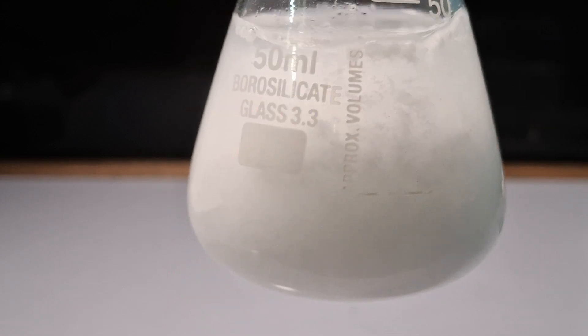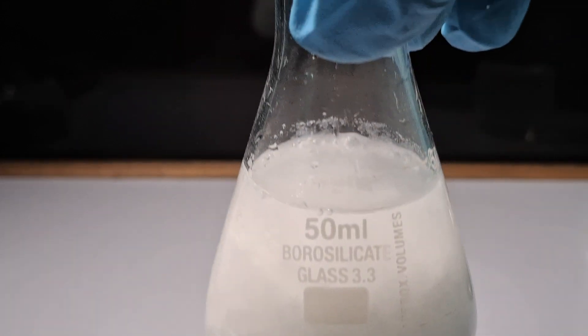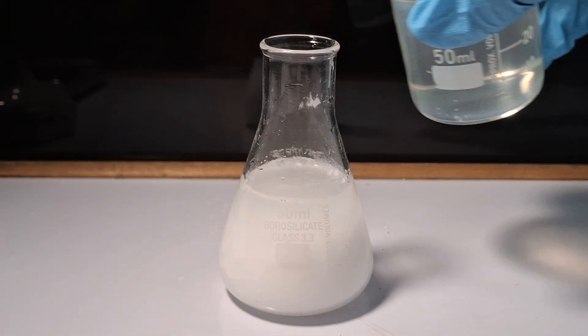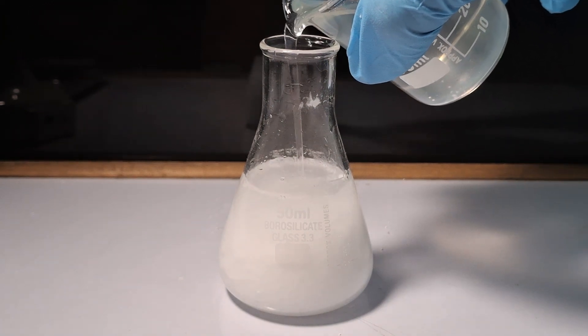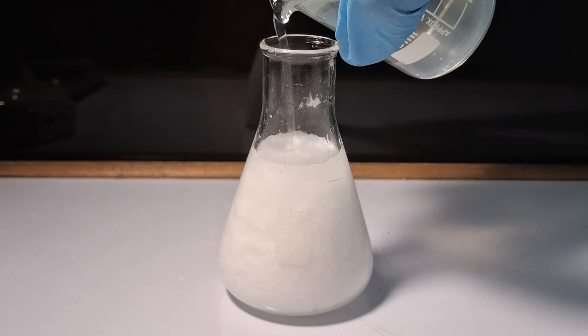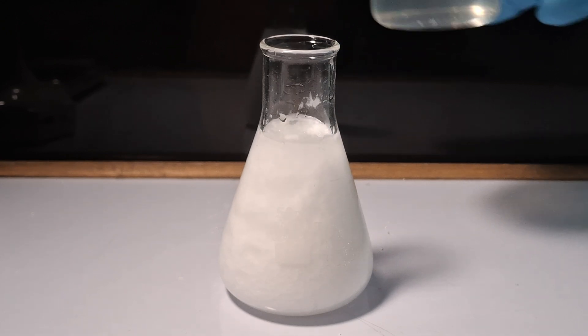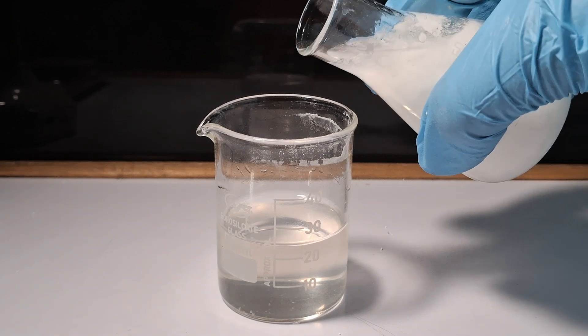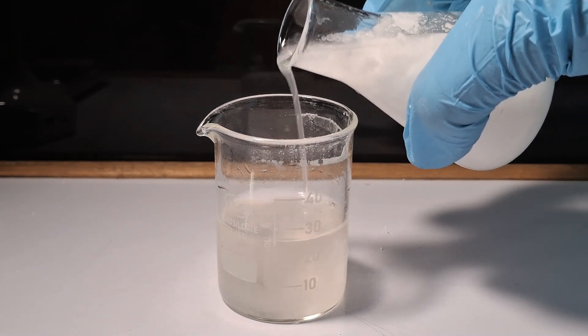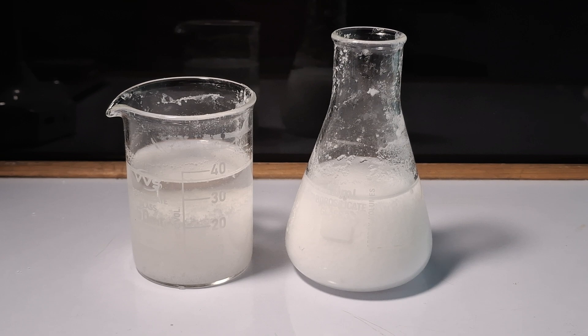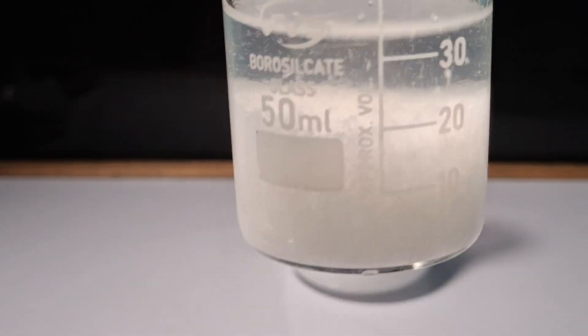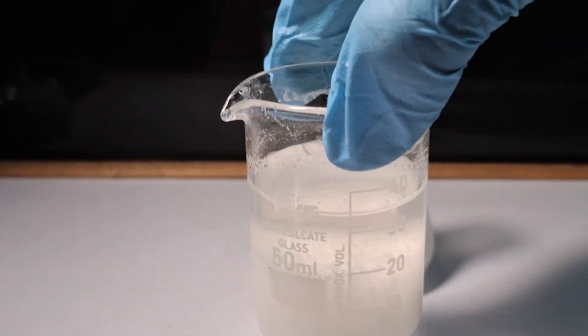Here you can see the benzoic acid up close. I continue mixing the solutions until all the benzoic acid has formed. Here you can see the benzoic acid that has settled to the bottom.